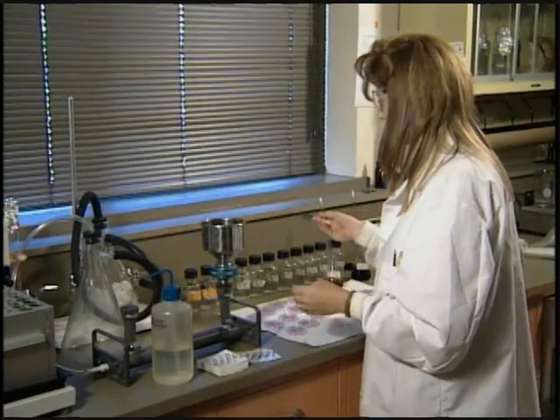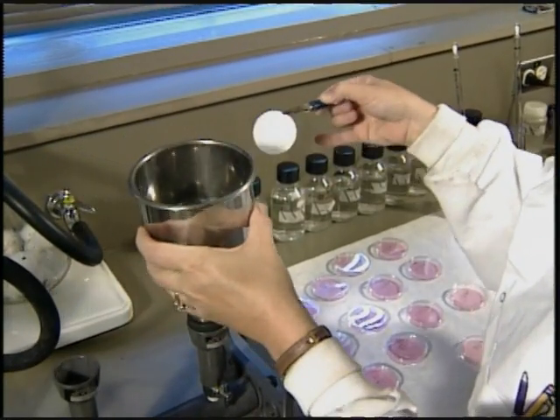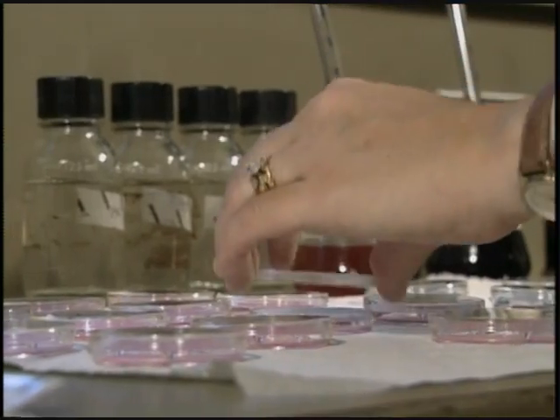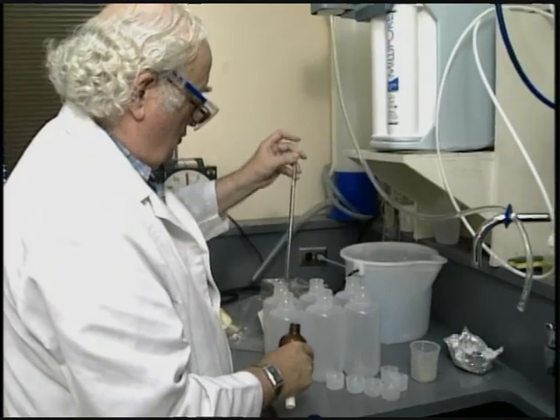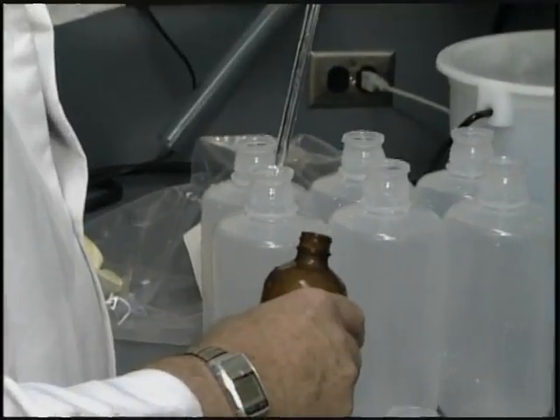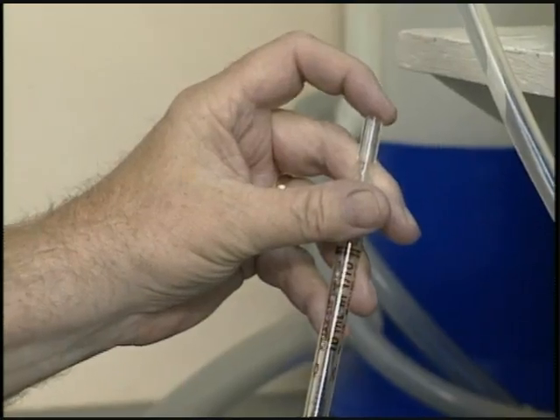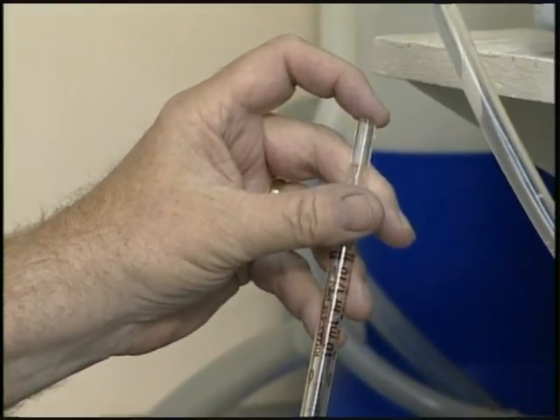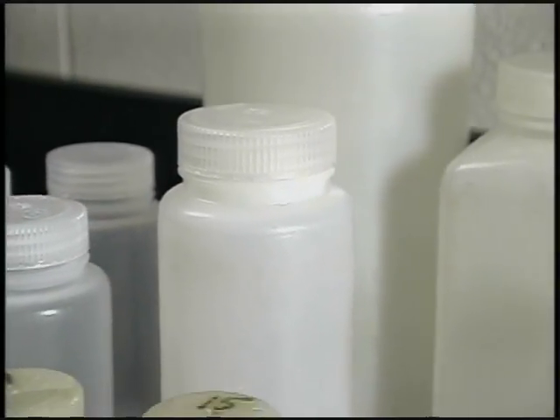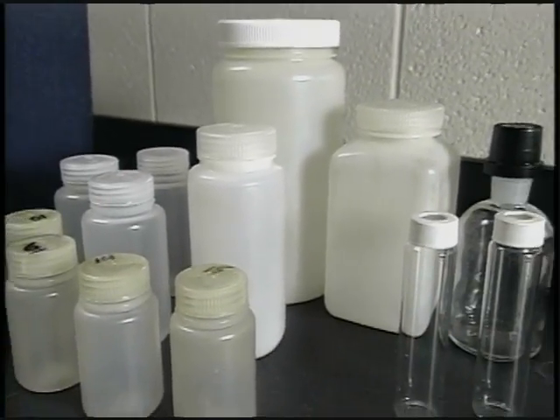Samples must be tested by a certified lab. This lab may be part of your utility, or you might send samples to an outside lab. The lab will provide sample containers. It is important to use only containers provided by the lab because they have been properly sterilized and, in some cases, treated with a stabilizing or dechlorination agent. Sample containers come in all sizes and can be either glass or plastic, depending on what tests will be performed.